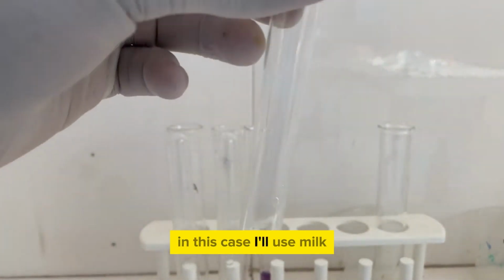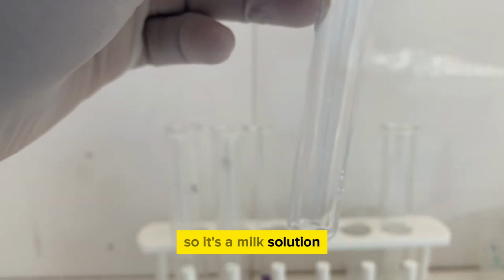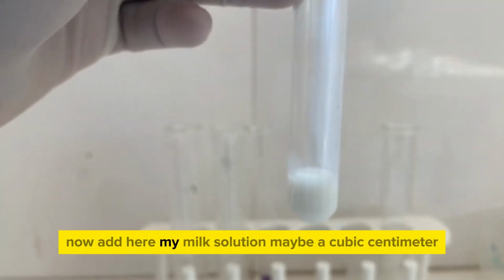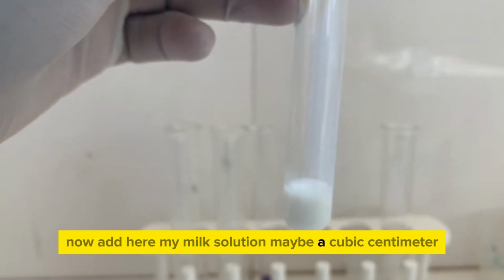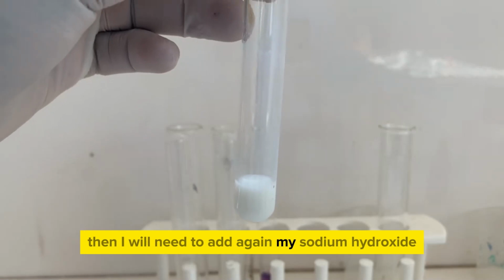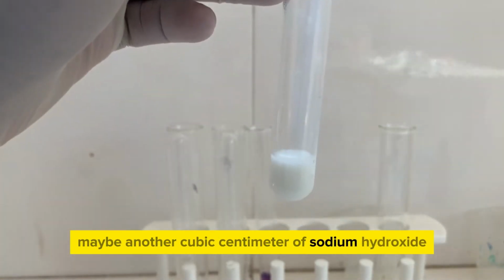In this case, I'll use milk. I've added my milk to some water, so it's a milk solution. I take another clean test tube. I'll add here my milk solution, maybe a cubic centimeter. Then I will need to add again my sodium hydroxide, maybe another cubic centimeter of sodium hydroxide.